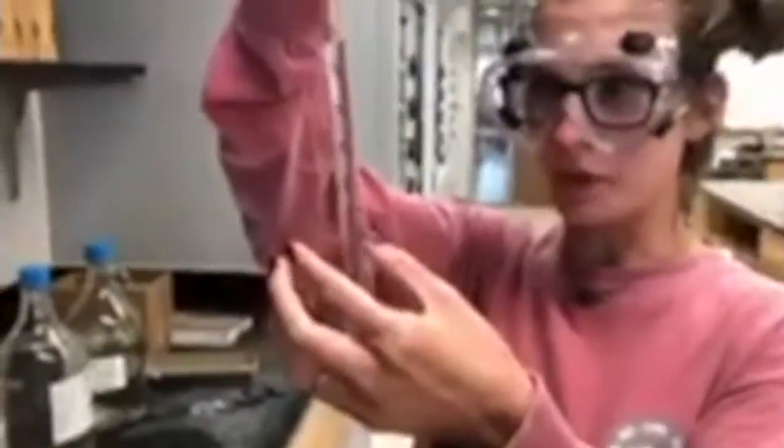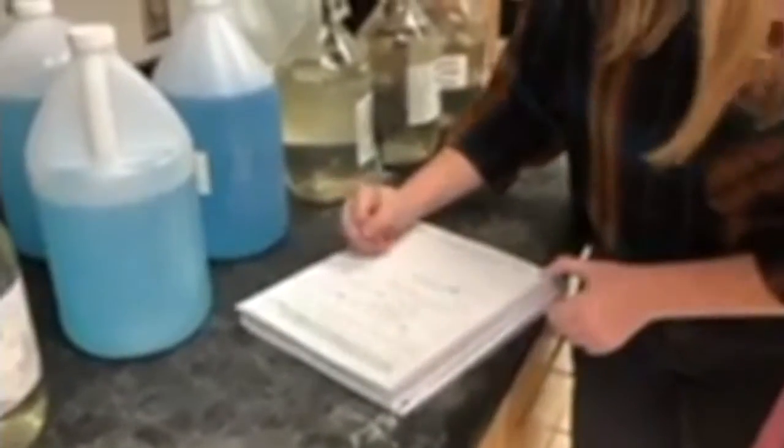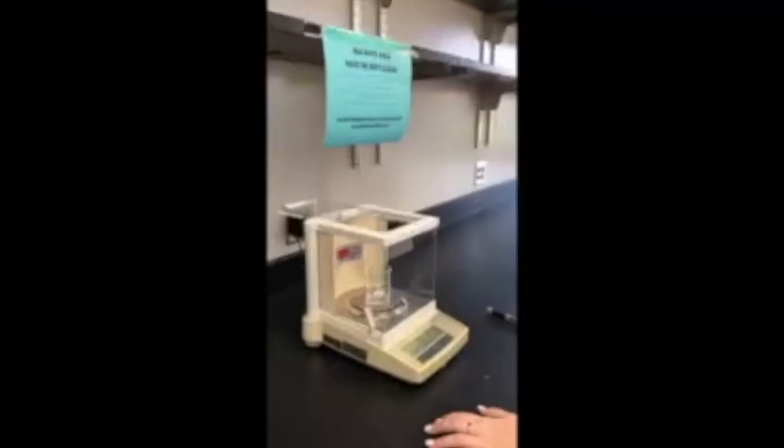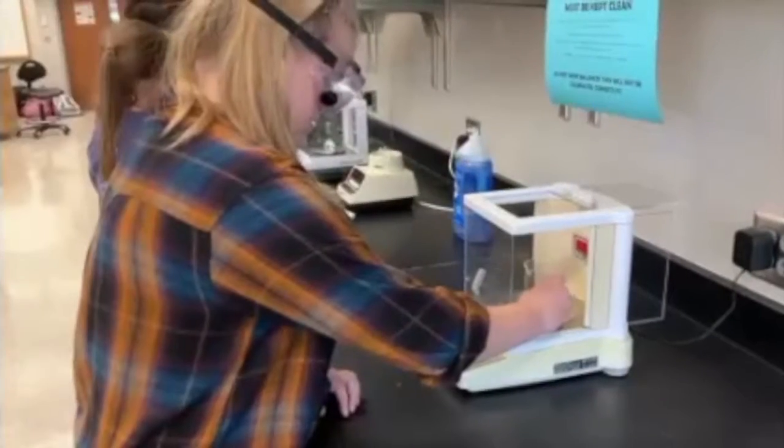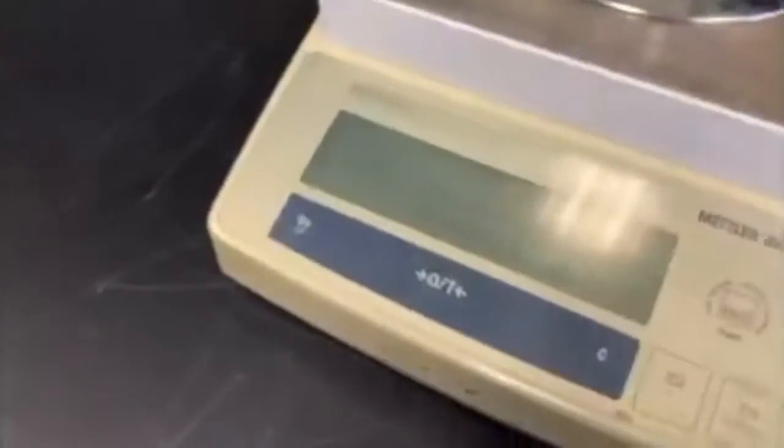In the equation C1 times V1 equals C2 times V2, your C1 is the original percent of whatever stock solution you're working with. V1 is the amount of liquid that you take from that, in milliliters or whatever you're working with, your initial volume. C2 is your unknown because you won't know that until you solve the equation out. And your V2 is whatever volume of glassware that you're working with. So if you have a 25 ml beaker, 100 ml beaker, however large it is, that is your final volume, because after you add your water in, that's what you're going to get. And then you just solve the equation out, and that will give you the exact percent of the new solution that you just made.